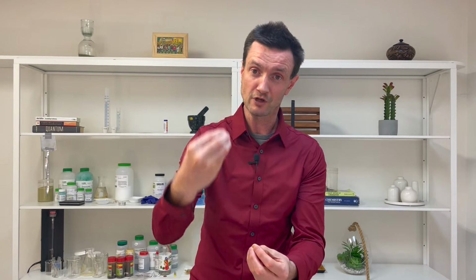Okay, so I think the results of this experiment are pretty clear. And in fact, they were probably clear to you even before you started, given the safety measures we insisted you put in place, basically dropping the calcium in a larger volume of water that keeps it cooler, not using a test tube, because if you dump calcium in even a little bit of water in a test tube, it'll spurt right out. So based on these safety measures, you may have foreseen that calcium was going to be more reactive than magnesium. So our results are clear. Of the alkaline earths, calcium is more reactive than magnesium.